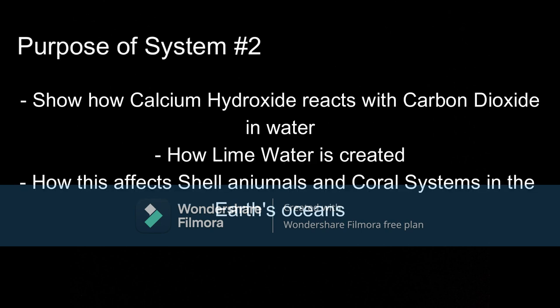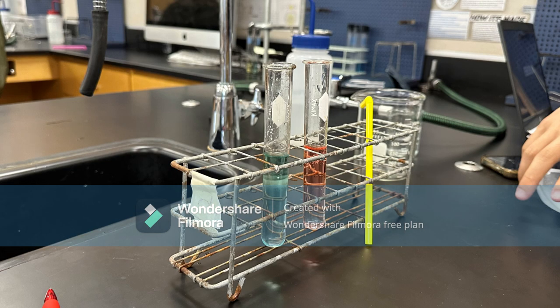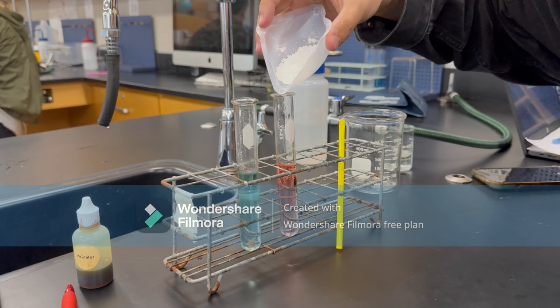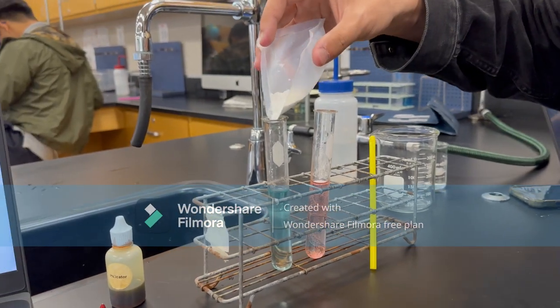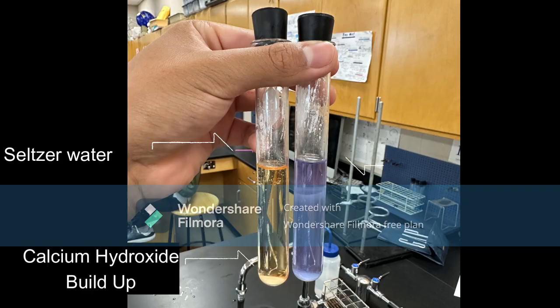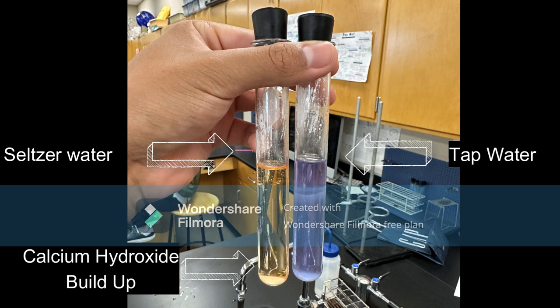The purpose of the system is to show how calcium hydroxide reacts when CO2 is in water, how lime water is created, and how this all affects shell animals and corals in the Earth's oceans. As we add the calcium hydroxide to create lime water, the process of creating calcium carbonate ions begins. From looking at the bottom of the test tube, we can see that there is more buildup in the seltzer water. This is because the calcium hydroxide is able to react with CO2 in the seltzer water and create calcium carbonate.